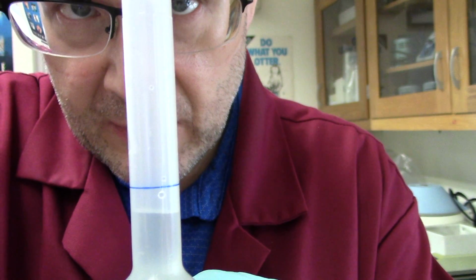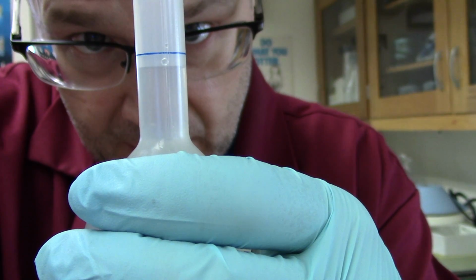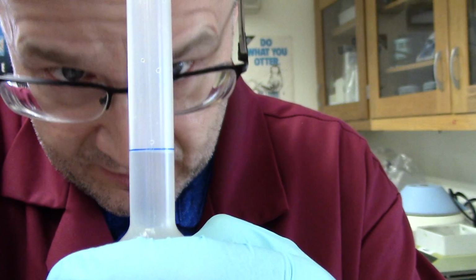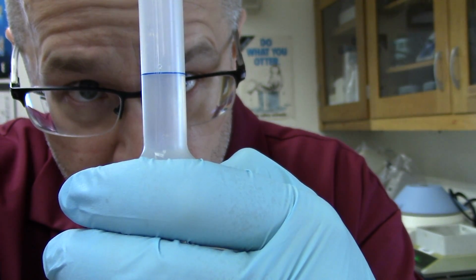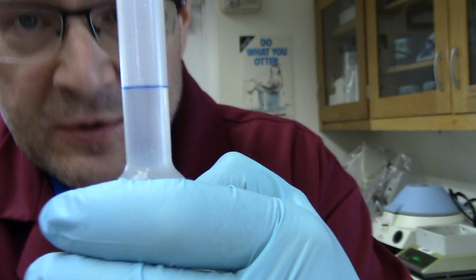So here I am over here. And I don't know if you can see this or not. Let's see if we can get it on camera for you. So then I'm just going to drop water to get that meniscus right on that line if I can. I need a little more water, just a touch more. Just a drop might be enough here. I don't know if you can see it or not, guys. I'm doing my best for you. I'm going to call that on the line. Looks good to me. All right, so there we go.